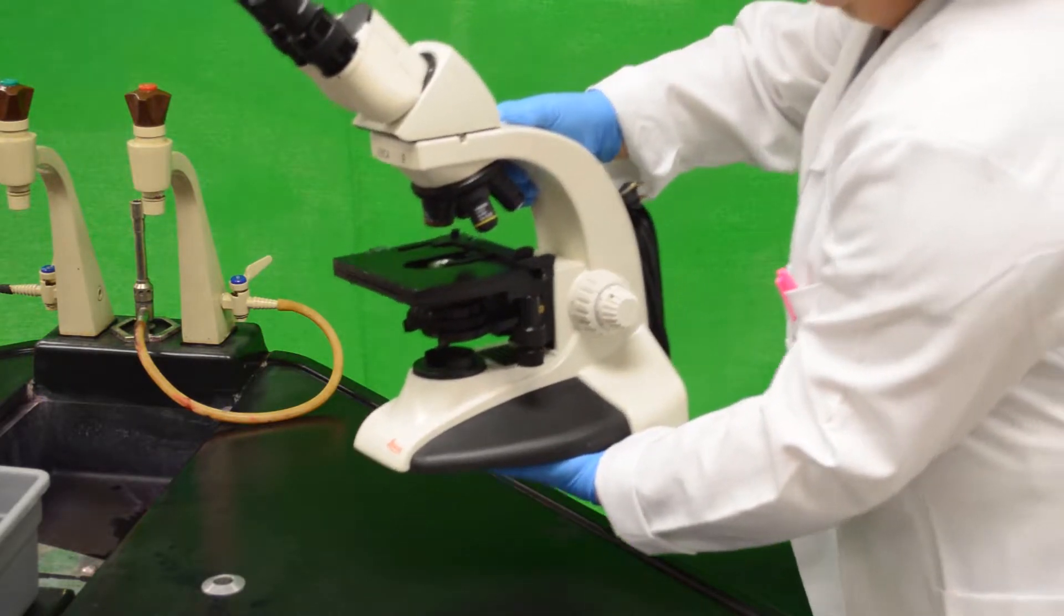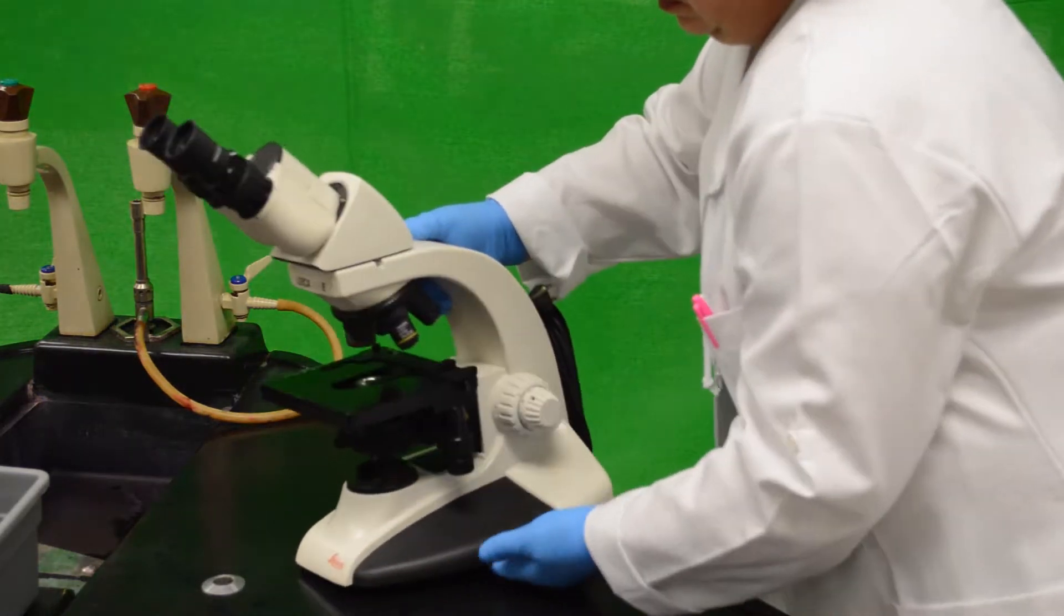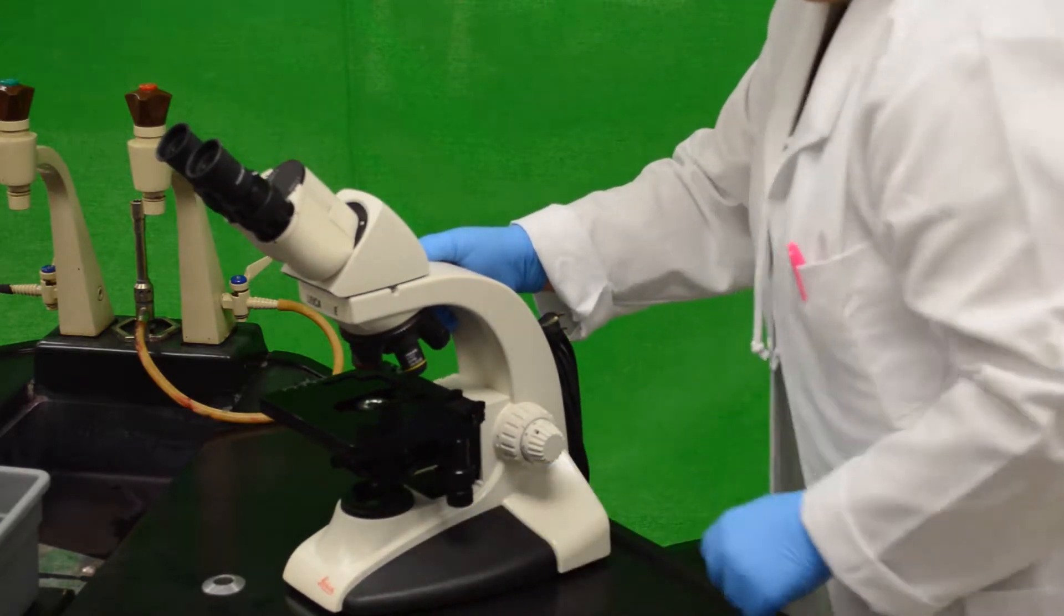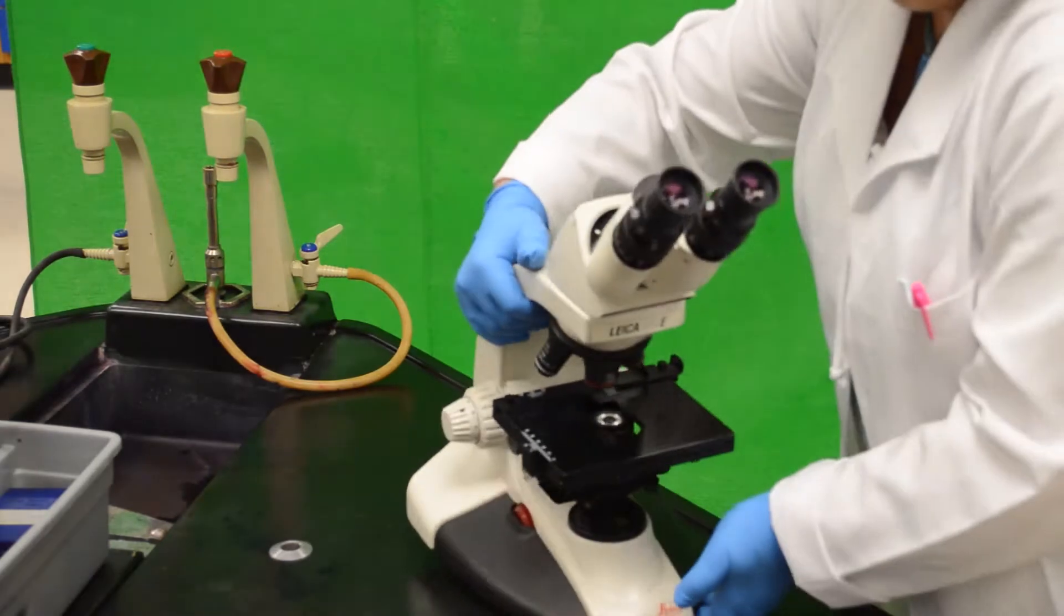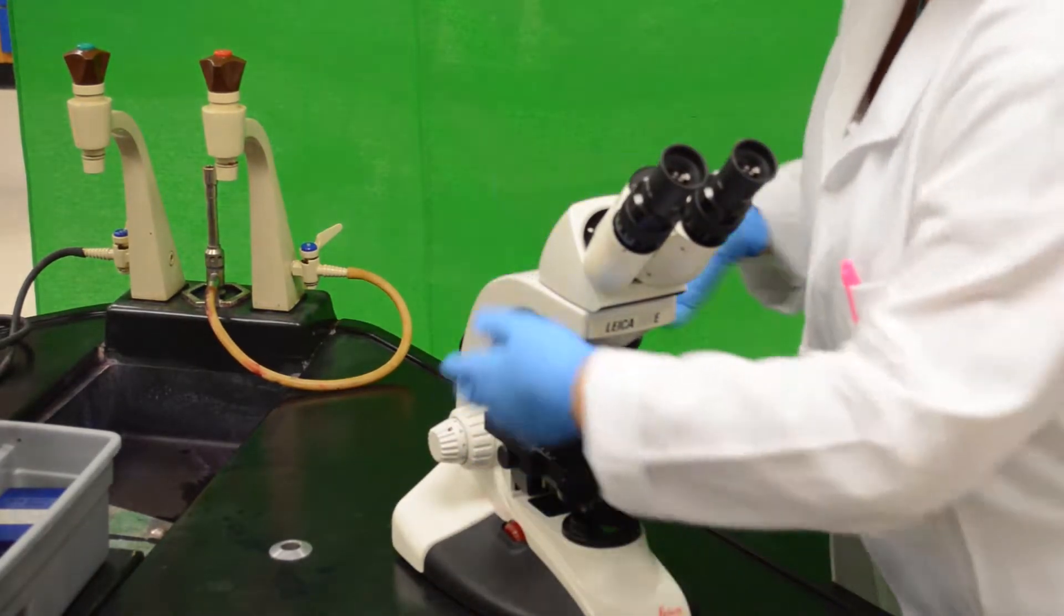First, always carry the microscope by the base and the arm using two hands. Never pick it up with one hand. Always keep it in an upright position.